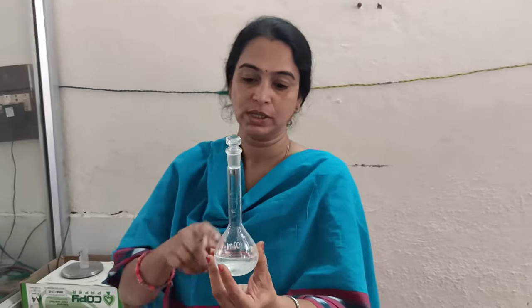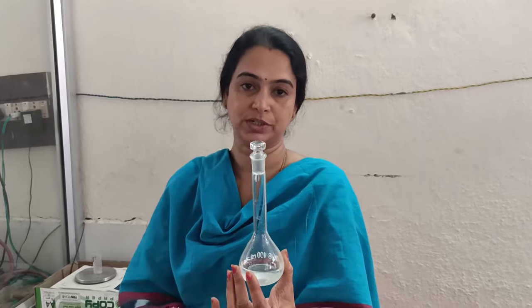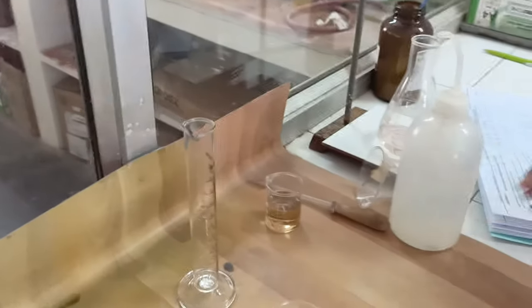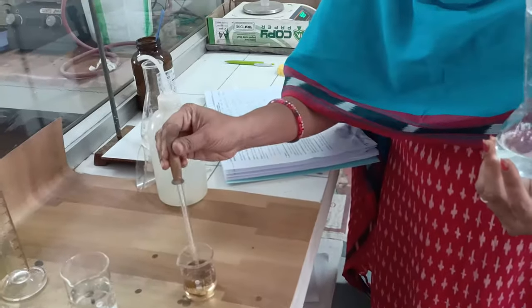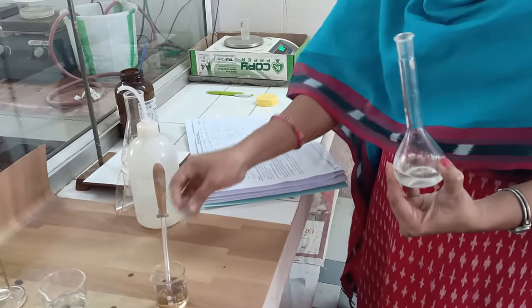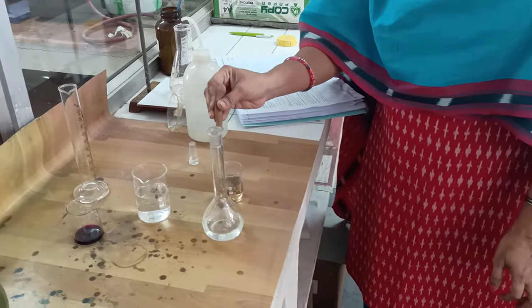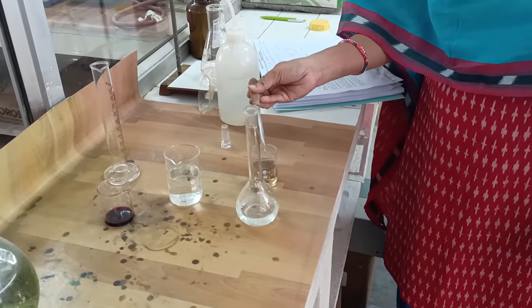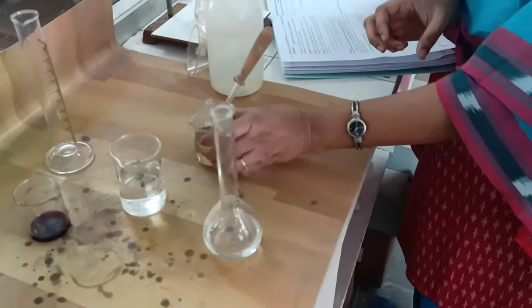The main important thing here is you need to add sulphuric acid. Why? Because ferrous ammonium salt undergoes hydrolysis readily and forms ferrous hydroxide precipitate. So in order to prevent hydrolysis and see that it doesn't undergo further oxidation, you need to add a few drops of concentrated sulphuric acid. You can also use dilute sulphuric acid. Add 3 to 4 drops. This sulphuric acid prevents hydrolysis of the FAS salt solution and prevents further oxidation — this is a very important point for your Viva.